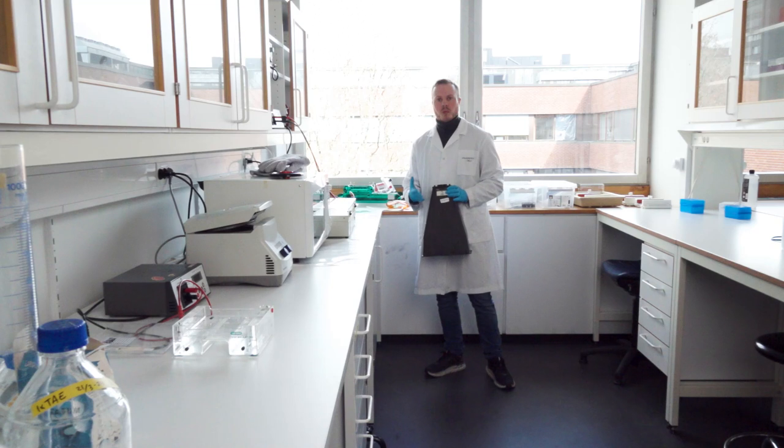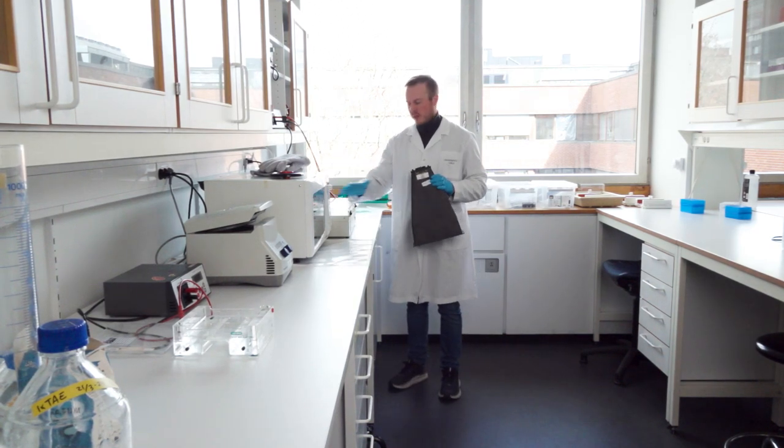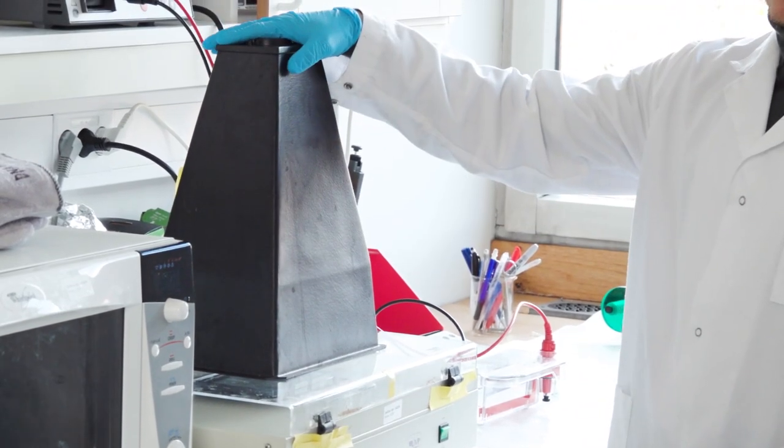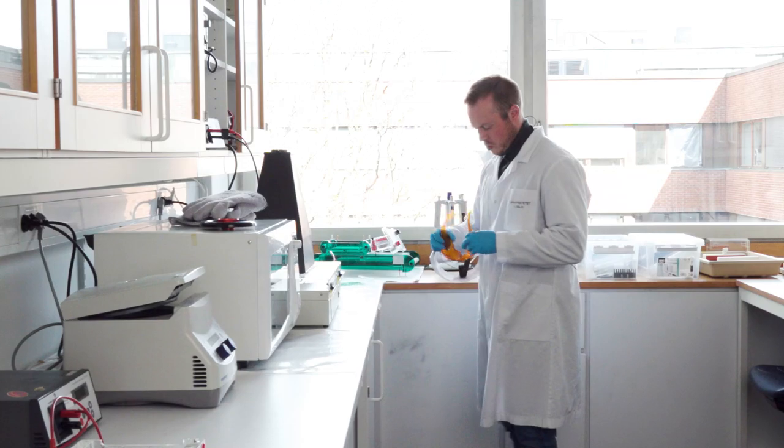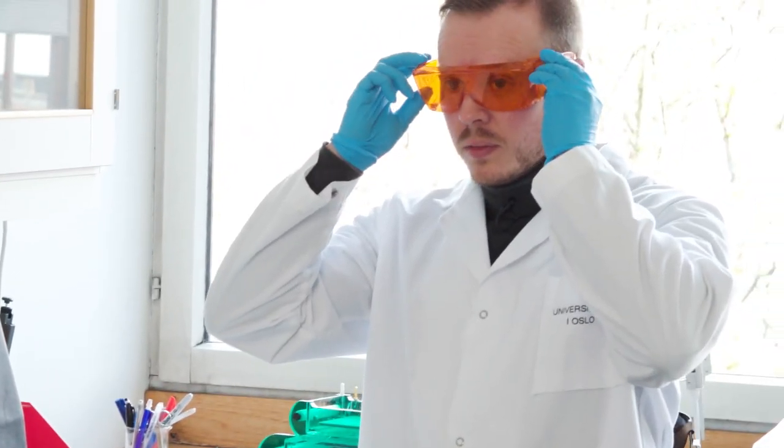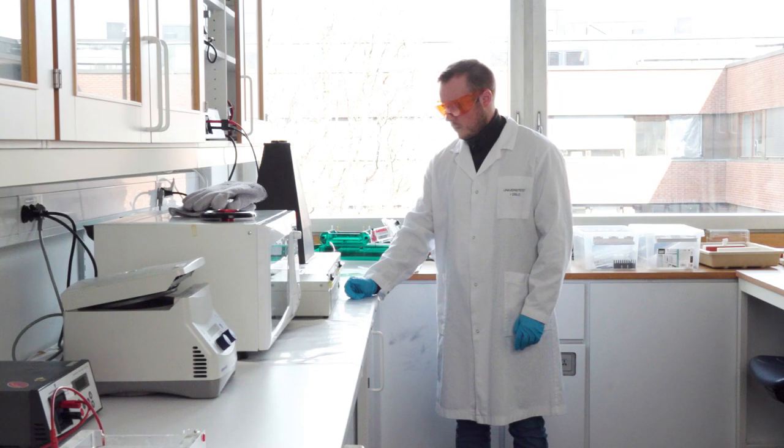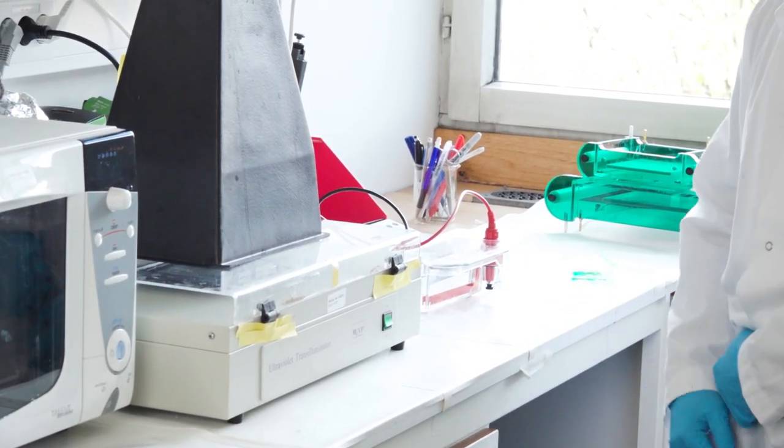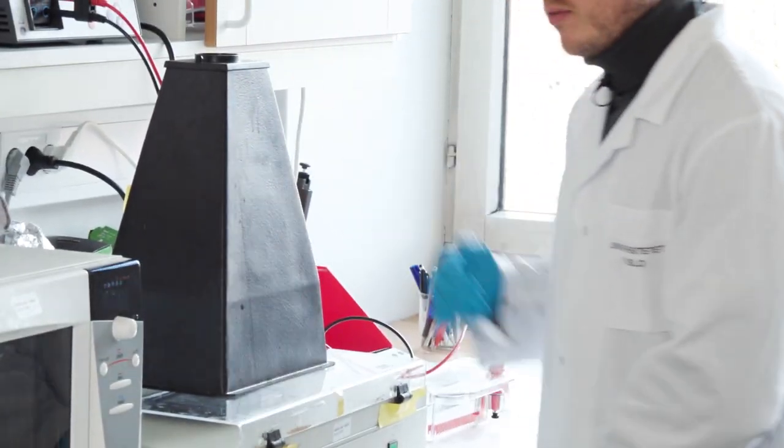So it's very important that you protect yourself. The first line of protection is this plastic screen. But also we add this black hood here as well. And we also use UV goggles. So then we turn it on. And you get a nice sound. And the UV light is on. So this is the opening you can see if you want.